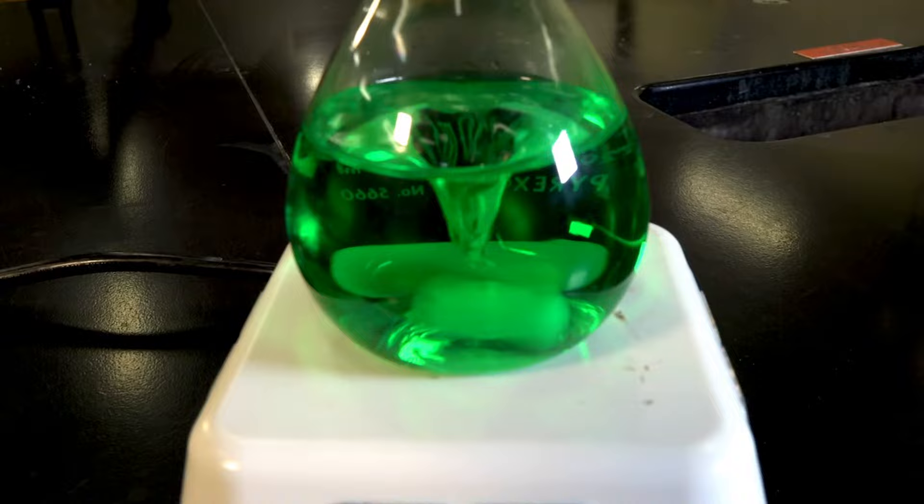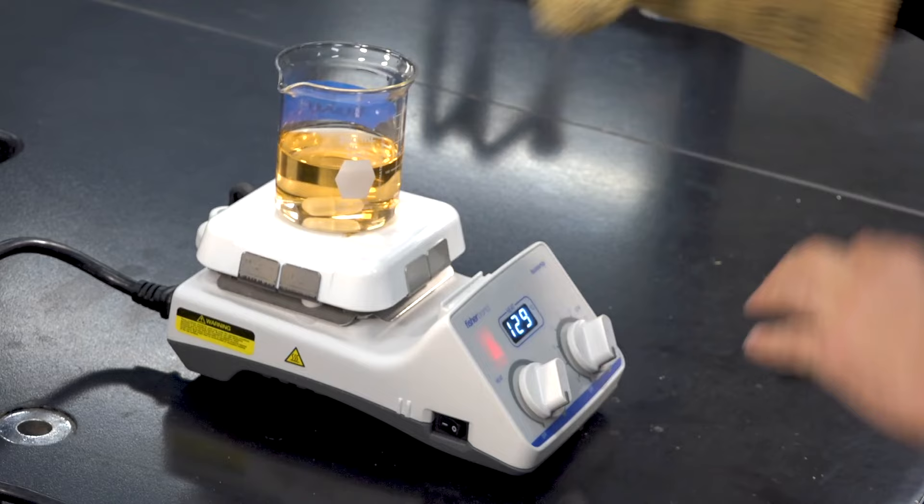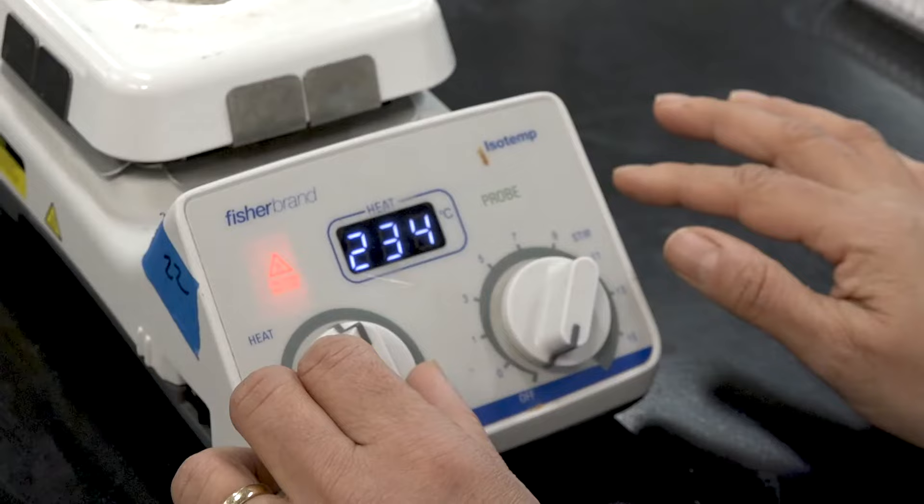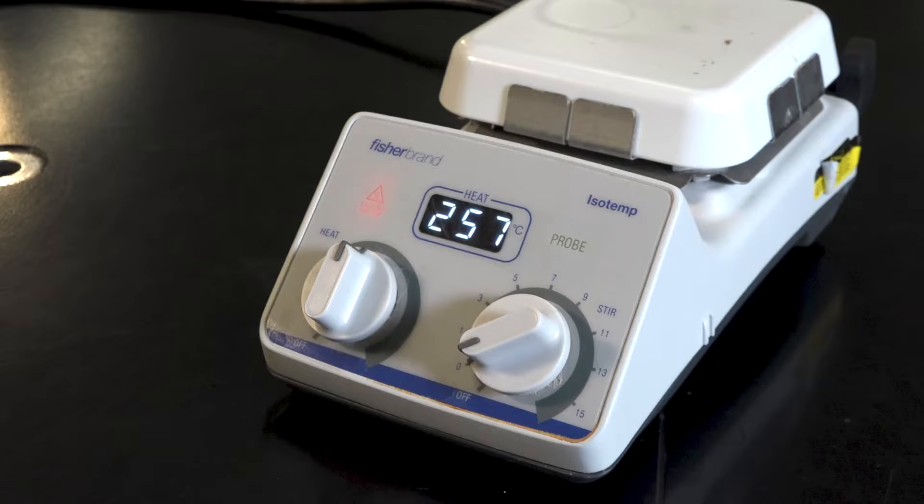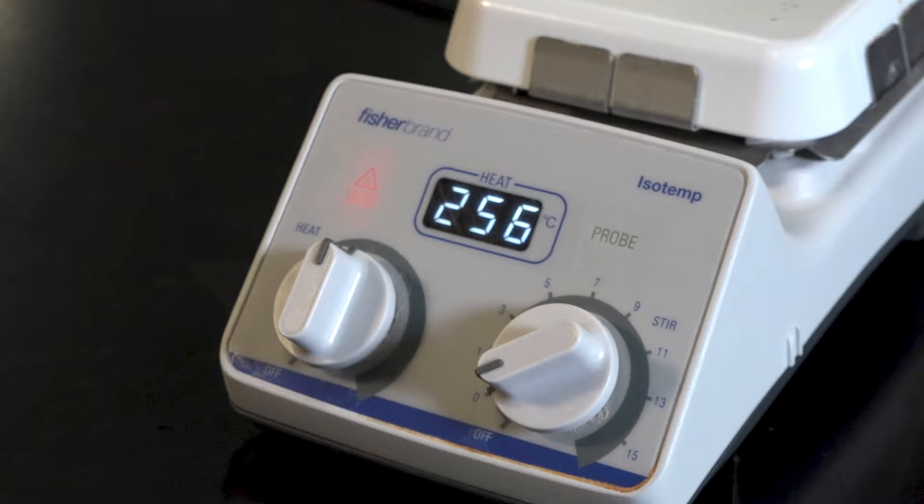The plate surface can get very hot, like ridiculously hot. For most experiments, you will never need to set your hot plate higher than half of its maximum value. Do not ever crank it to the maximum power. This can cause decomposition of your sample, broken glassware, or even fires. Ask your instructor if you're unsure what to set your hot plate to.